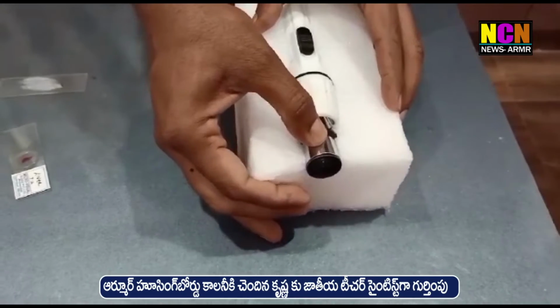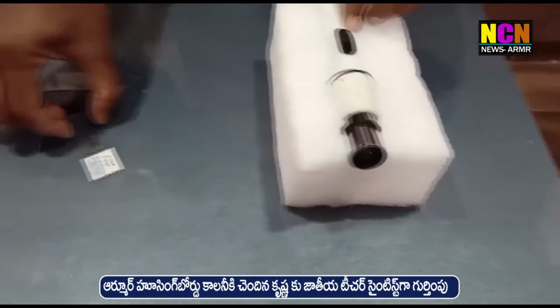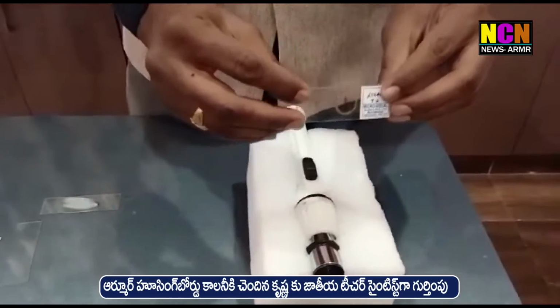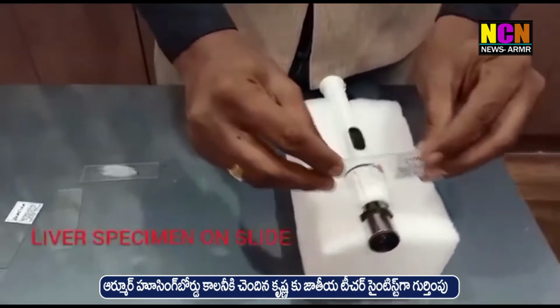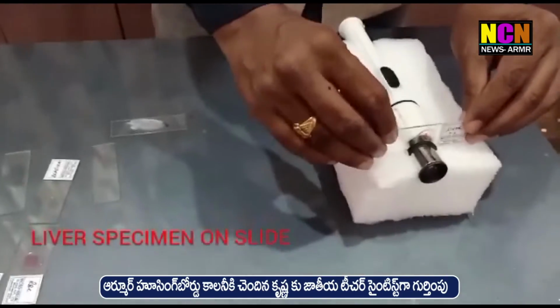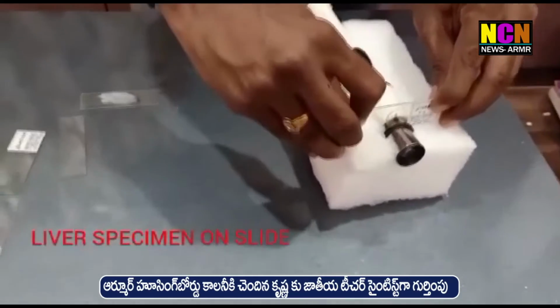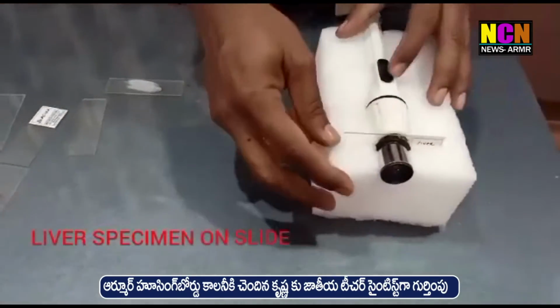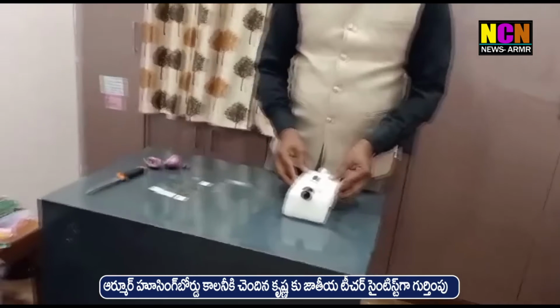Whatever slide specimen we want to project on a wall in a classroom, we have to place it in between both of these like this. After setting like this, we have to switch off the lights.